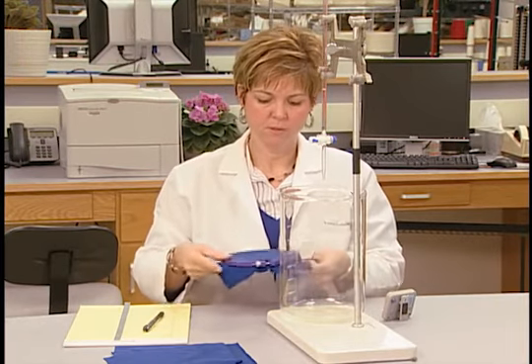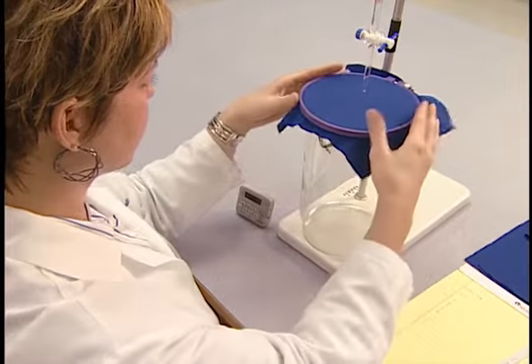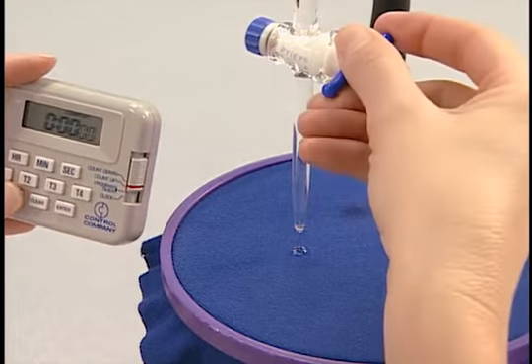The test procedure is a simple one, using a burette and burette stand, an embroidery hoop, a stopwatch, and distilled water.